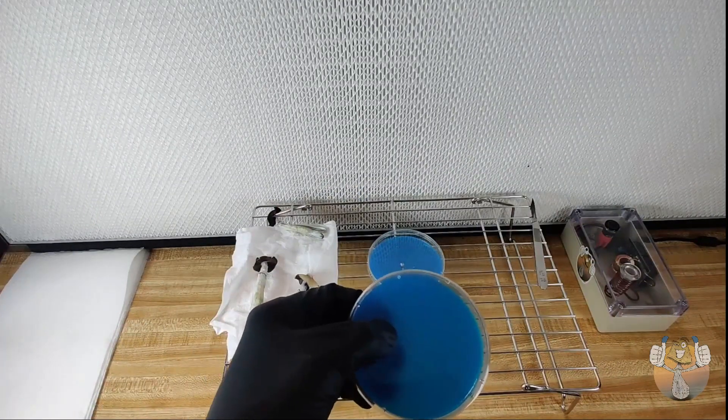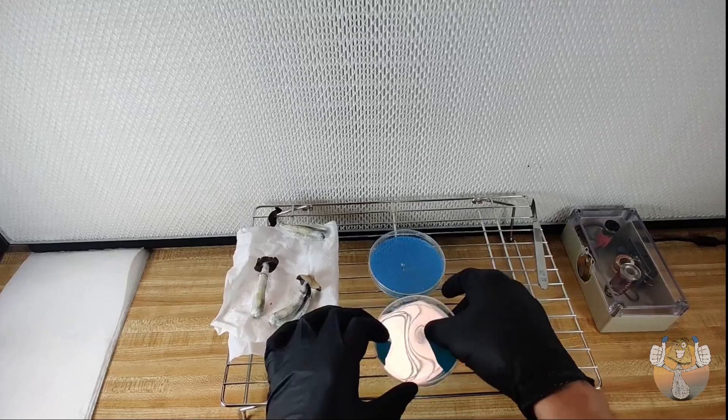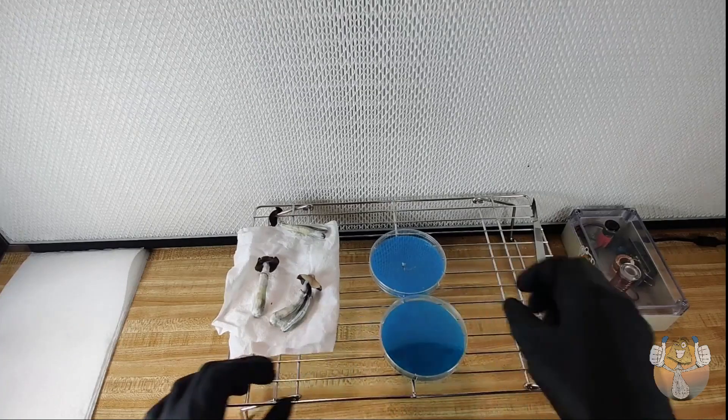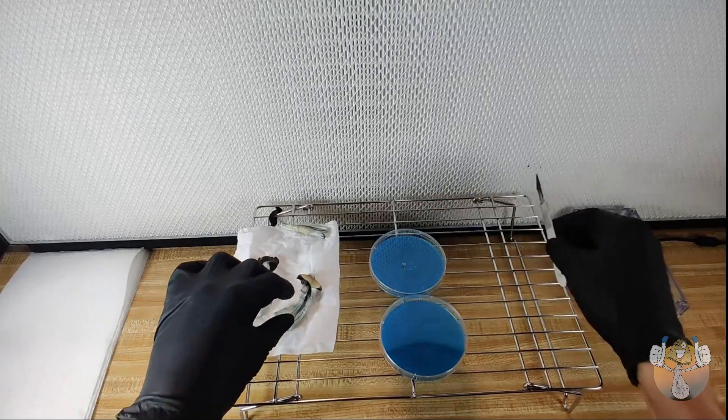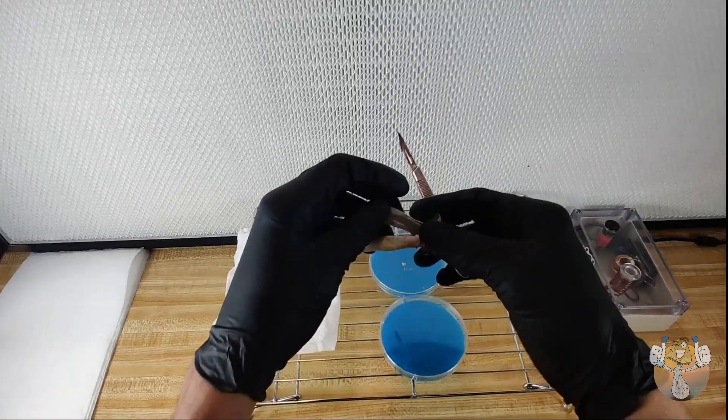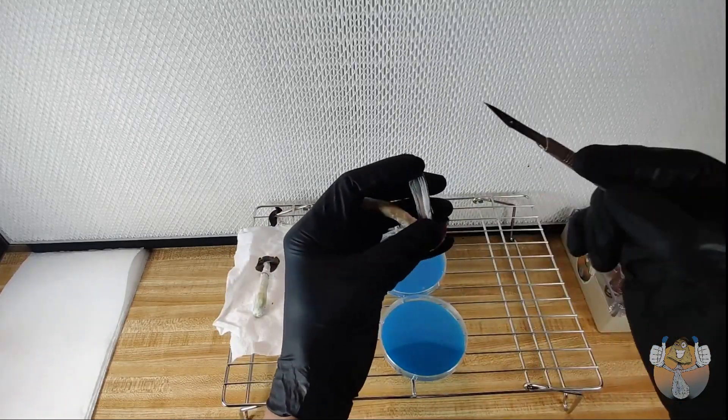Now generally when I'm taking clones, I usually take about four to six just in case, and especially if they're good genetics, you want to keep that in the library for a little bit.